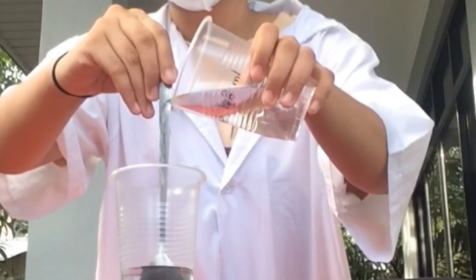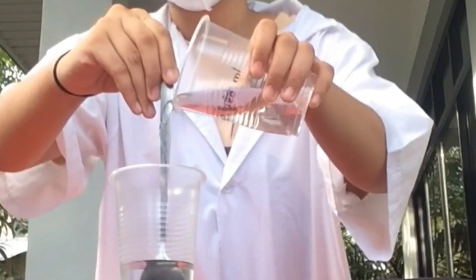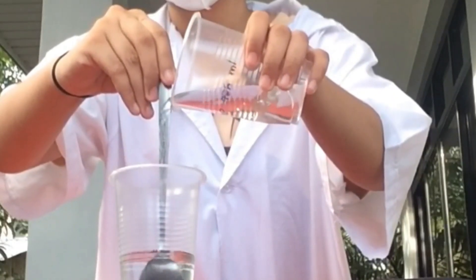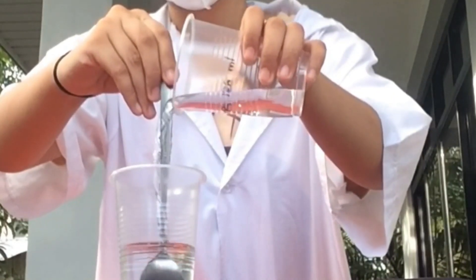As you can see in the video, there is no spillage when using a spoon for transferring liquids.